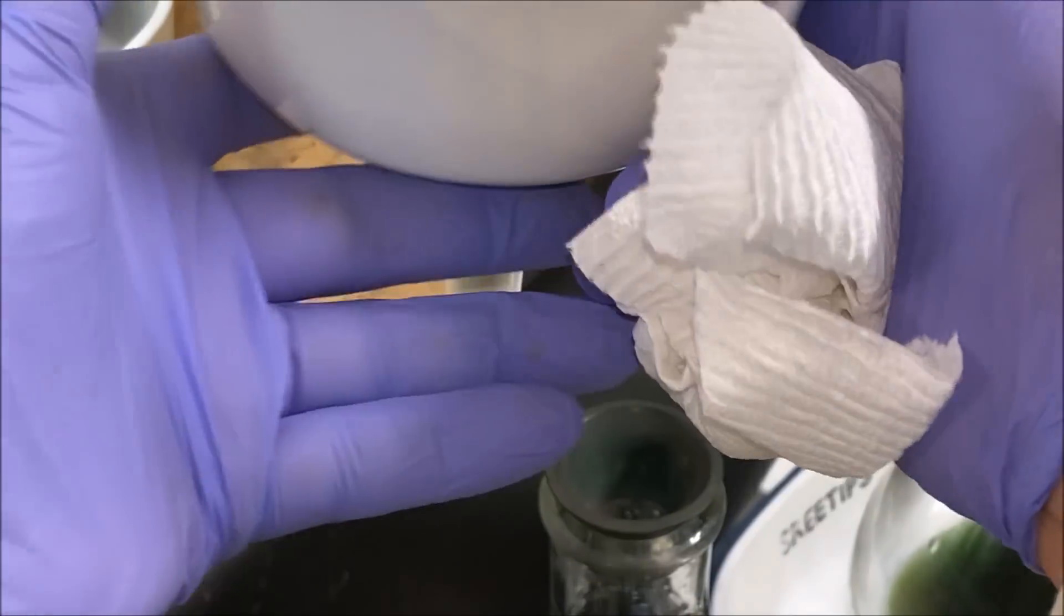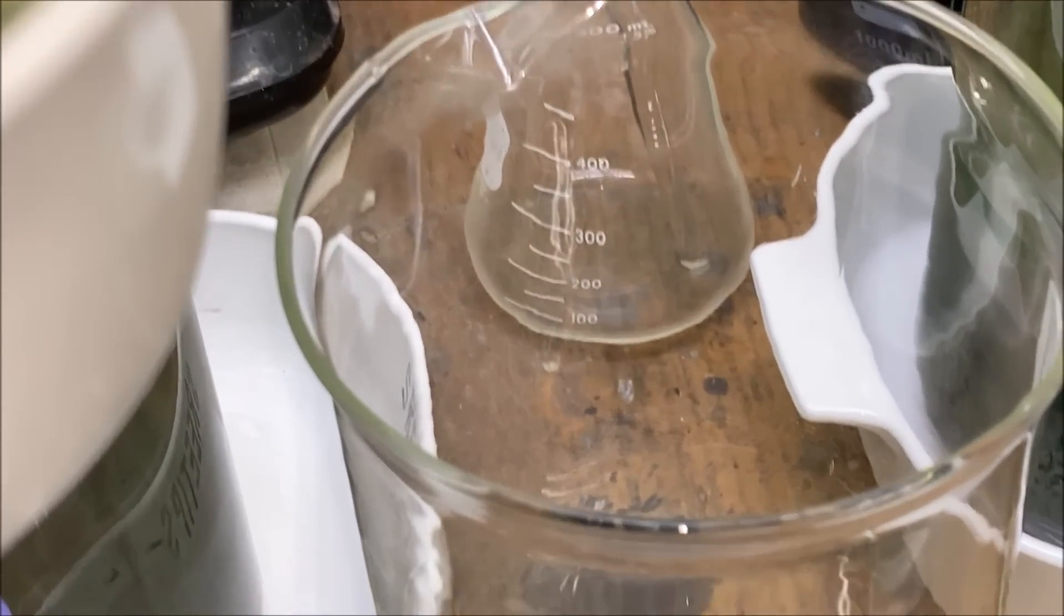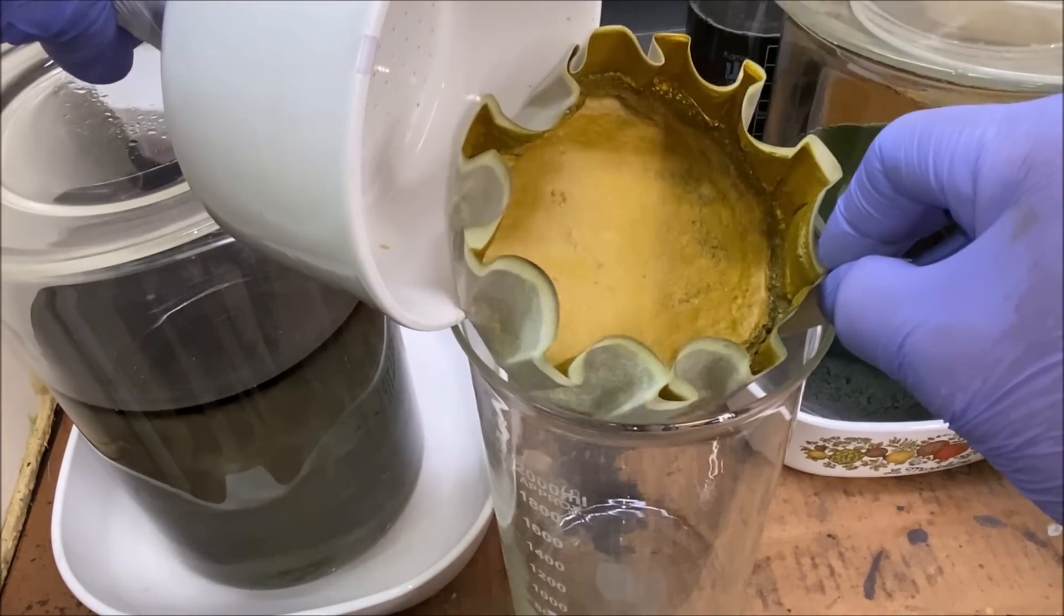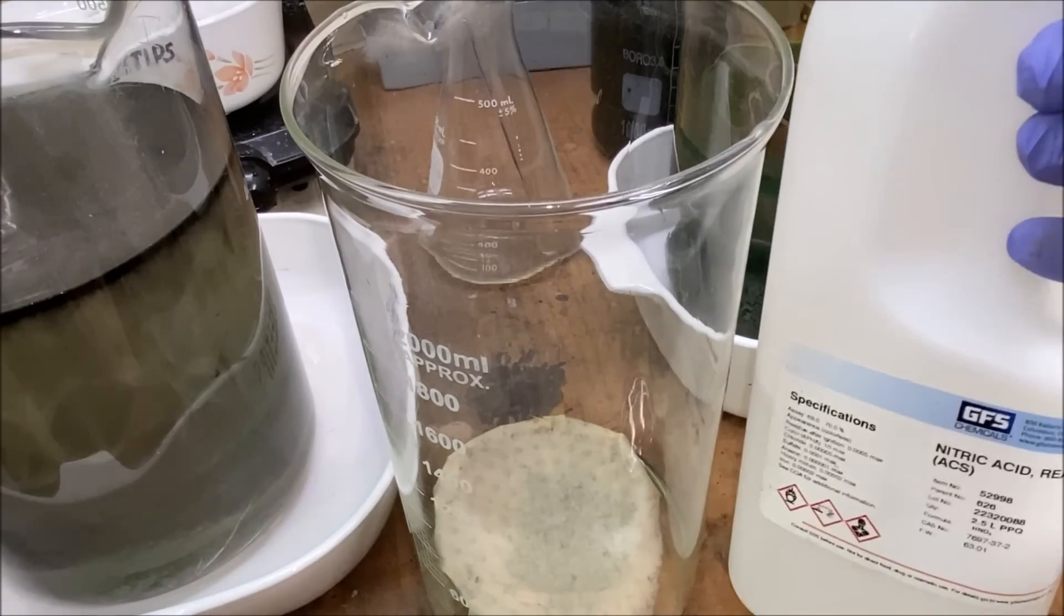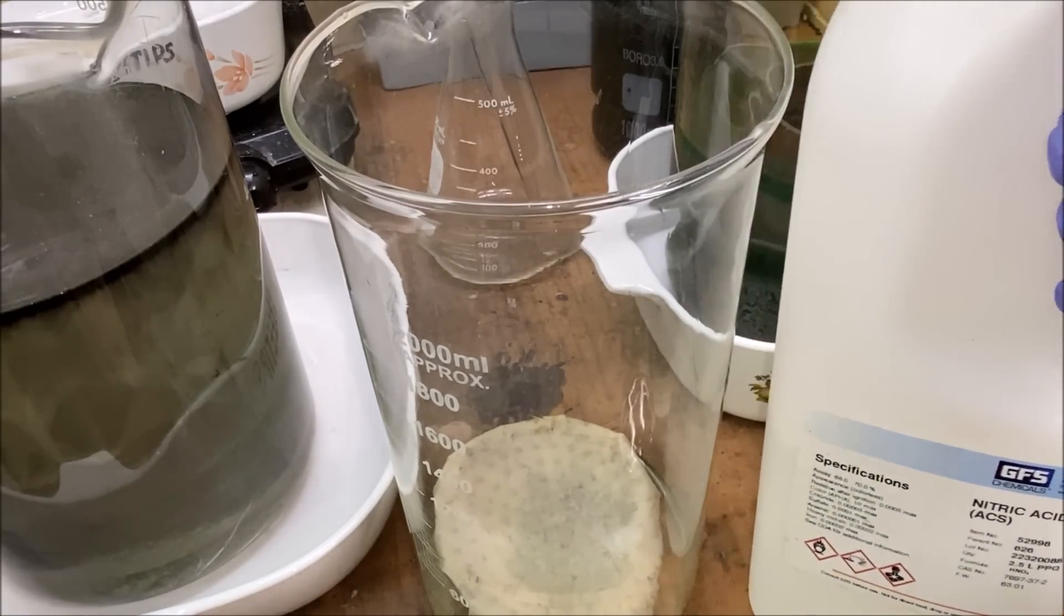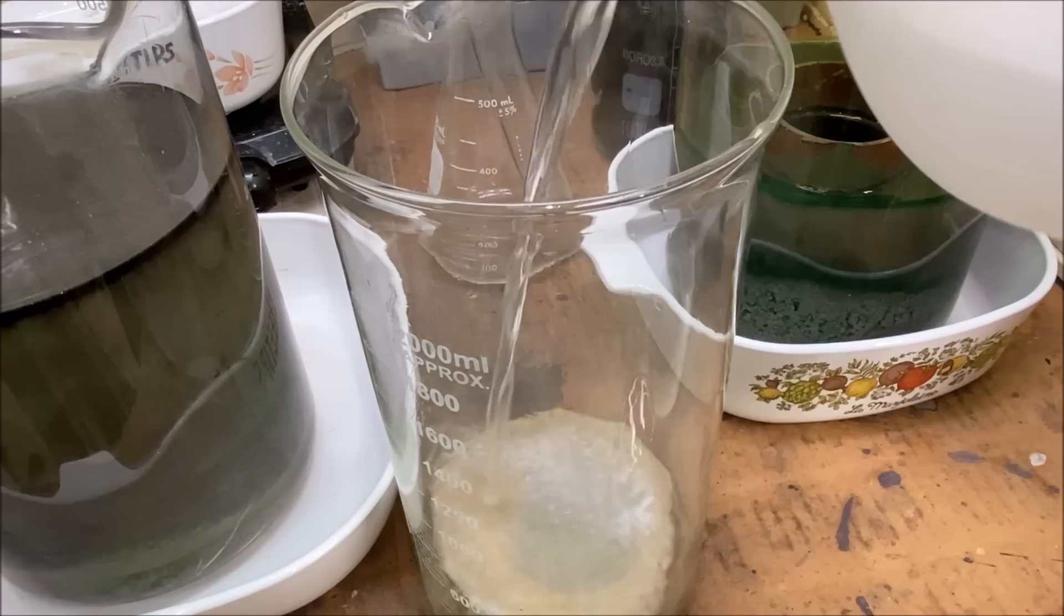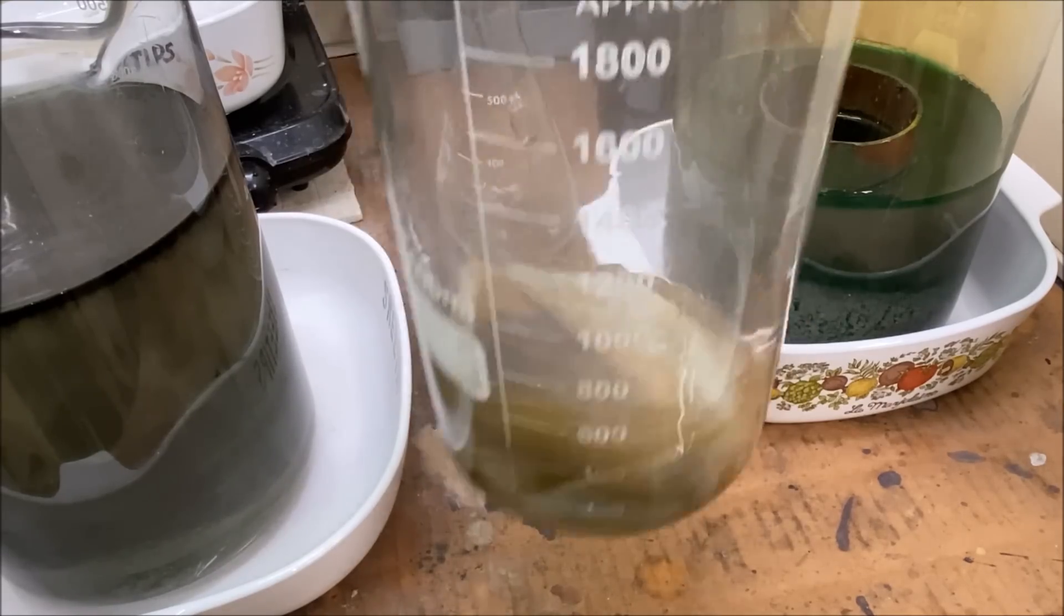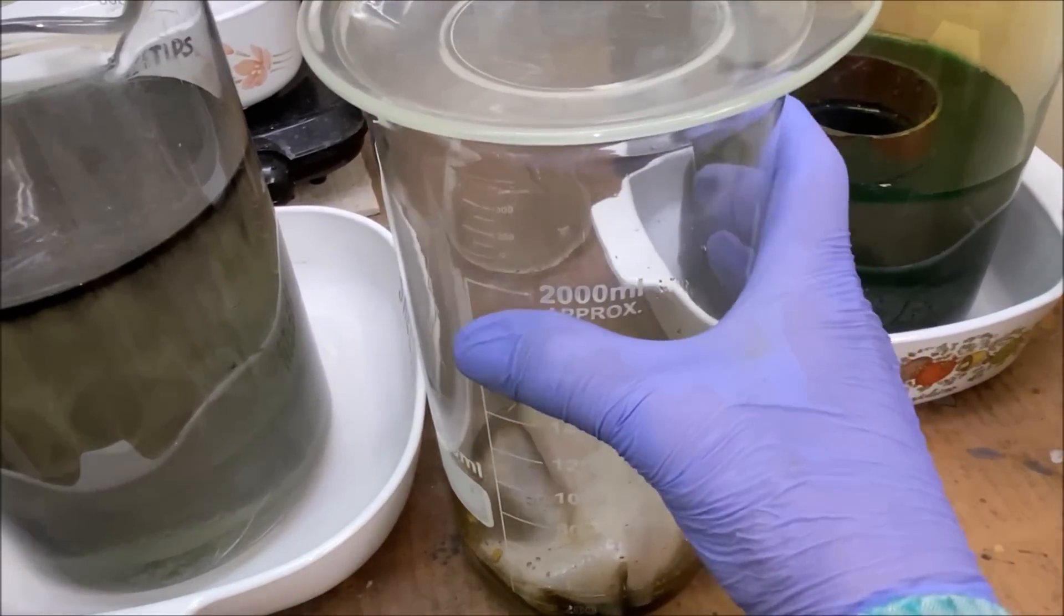This is our dmg precipitate in here. Let's take it over here and put it in this beaker. I'm adding a little bit of distilled water. Now what we'll do is put a little bit of nitric acid in here, try to dissolve the metallic silver that's in here with our precipitate. I don't know what's going to happen to the precipitate if it's going to go back in solution or not. I'll cover this up and set this back on the heat.